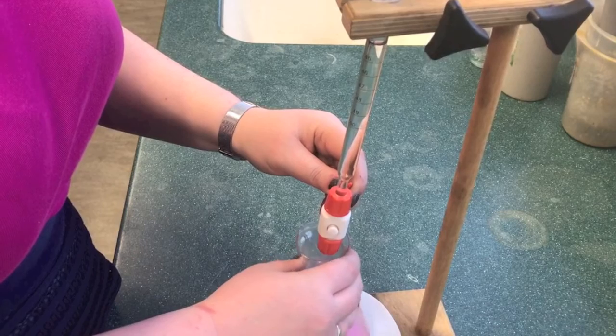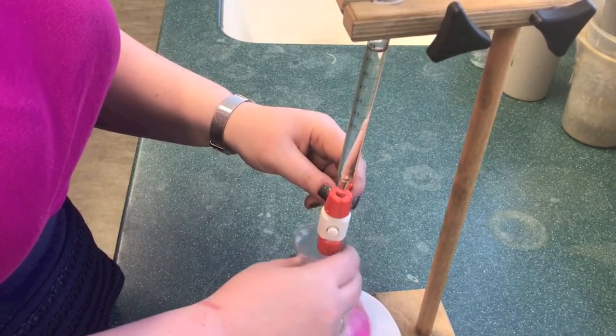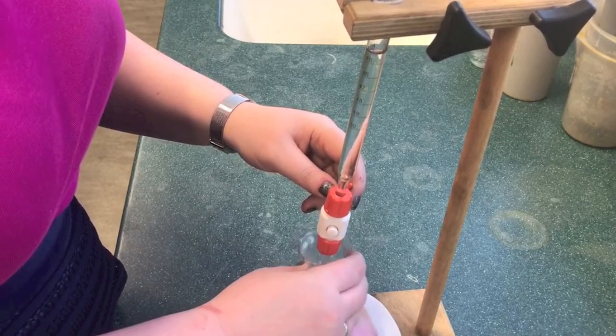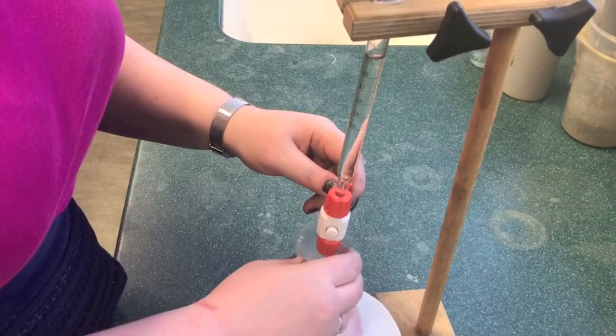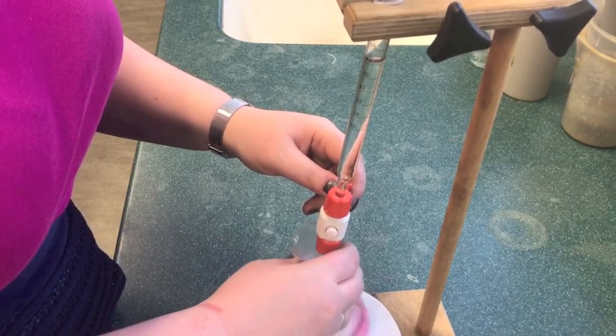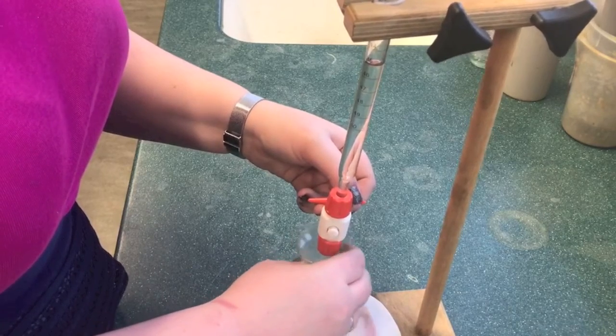The new start value is noted from the burette. It was 24.9 here. The end point can be estimated from the rough titer, which was 20.1. For this reaction, we know we could add about 19 ml of solution before the end point will happen. So we can add this quickly from the burette.